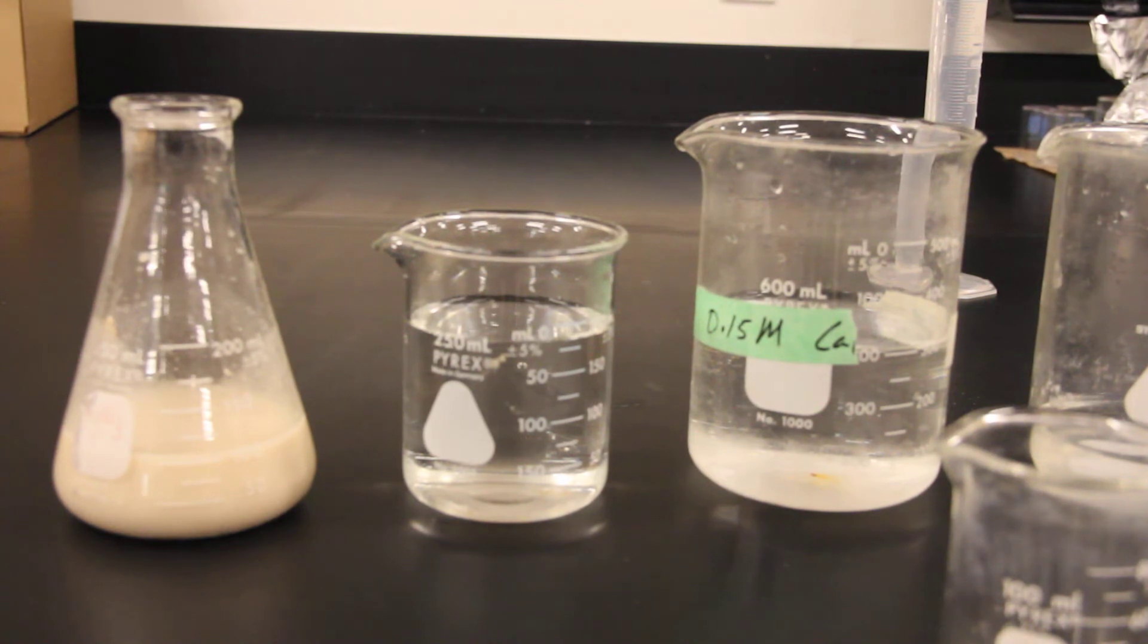In this video I'm going to show you how to make those yeast spheres and the initial reaction that we're going to be investigating looking at the enzyme catalase. We're using yeast as our model organism because yeast are eukaryotic, so they're closer to you and me than bacteria, and yeast have catalase.